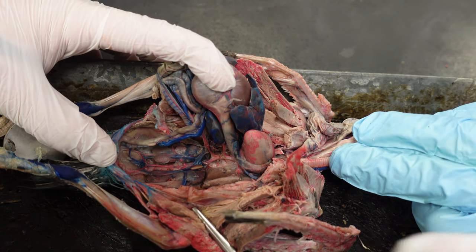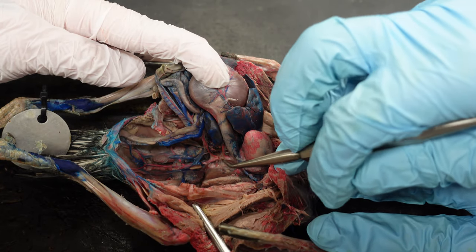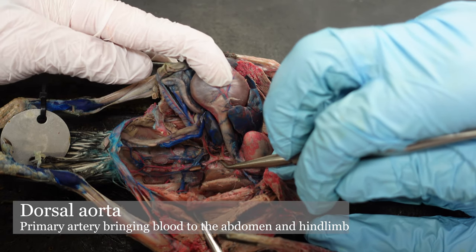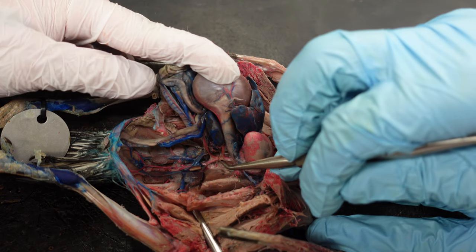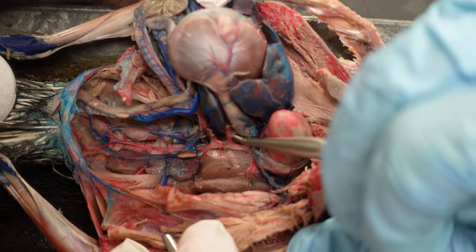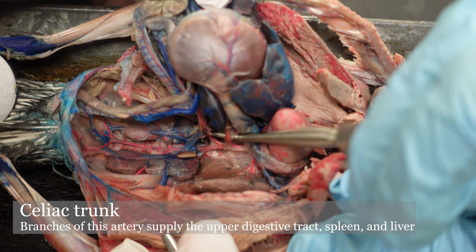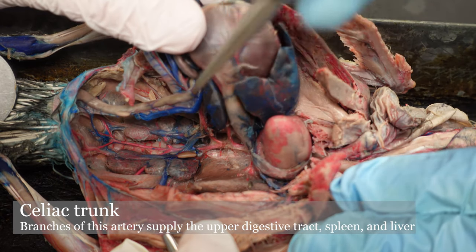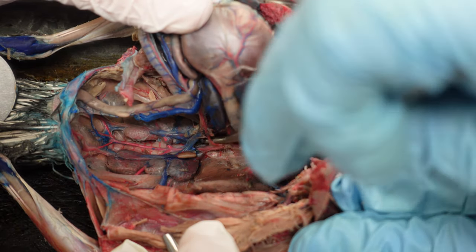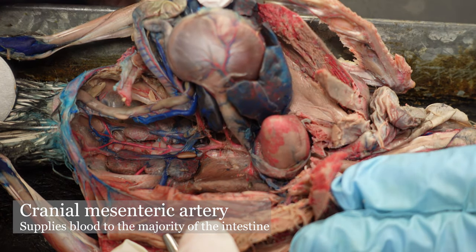Now let's take a look at the vessels of the abdominal region of the pigeon. Starting with the arteries: the first one coming down directly from the heart is the dorsal aorta, also called the descending or posterior aorta — any of these is fine. The dorsal aorta comes directly from the heart. Very similarly to the rabbit, this is the celiac trunk going toward the proventriculus, the gizzard, the spleen, and the cranial portion of the digestive tract. And then this one is the cranial mesenteric artery going toward the intestine — basically identical to in the rabbit.